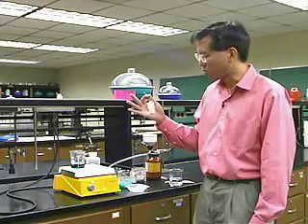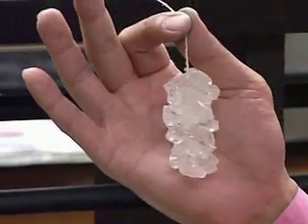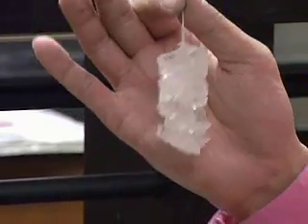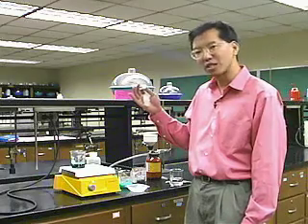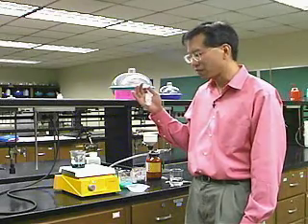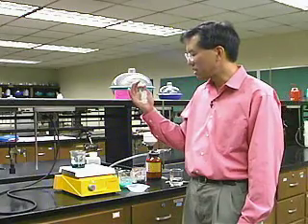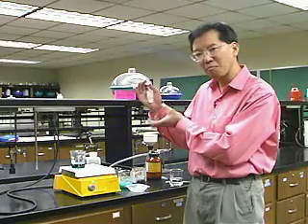You ever wonder how they make rock candy? Rock candy is sucrose, cane sugar, that has been crystallized into great big gigantic crystals. And the technique that they use is called crystallization. I'm going to demonstrate the technique of crystallization for you using acetylsalicylic acid, which is the active ingredient in aspirin. Crystallization is a way to purify a compound because the crystals form in a very pure form.